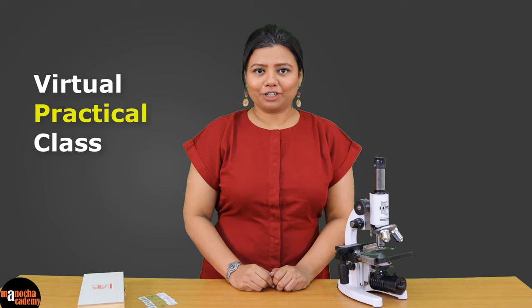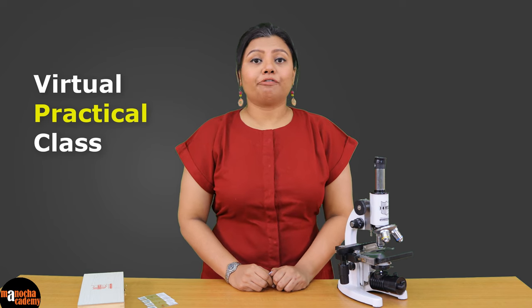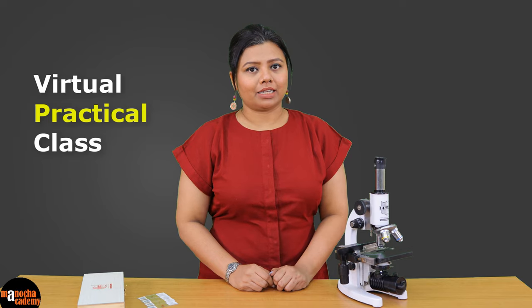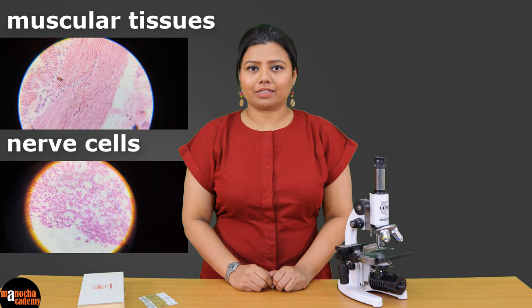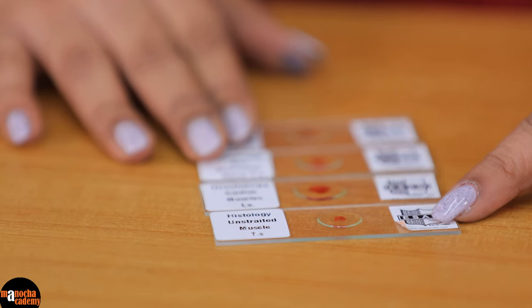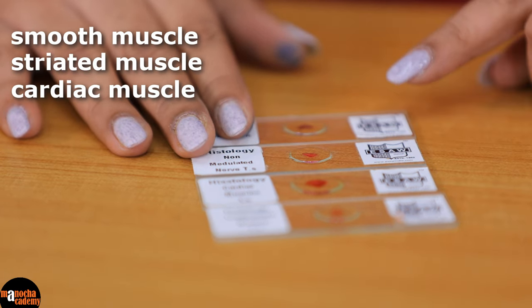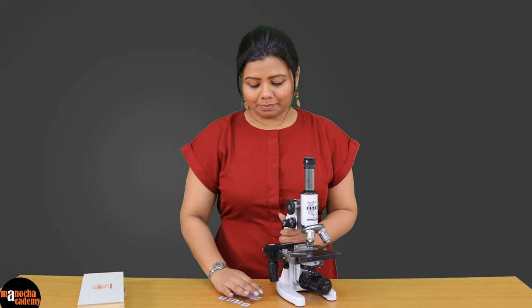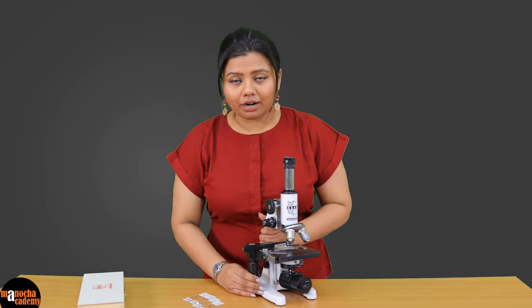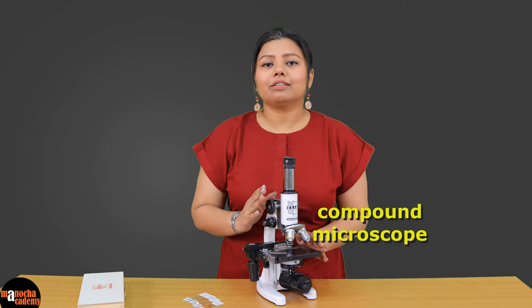Hello everyone. Welcome to the virtual practical class of Manocha Academy. In today's class we are going to observe a few prepared permanent slides. These are slides of different types of muscular tissues and nerve cells. I have four prepared permanent slides of smooth muscle, striated muscle, cardiac muscle, and a slide of nervous tissue. I will use a compound microscope at low power and high power to observe the different tissues.